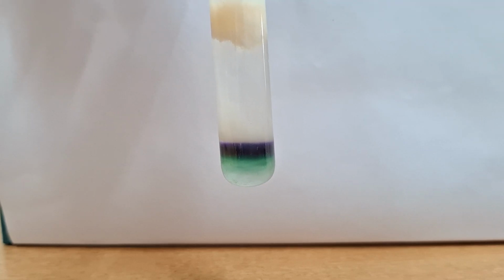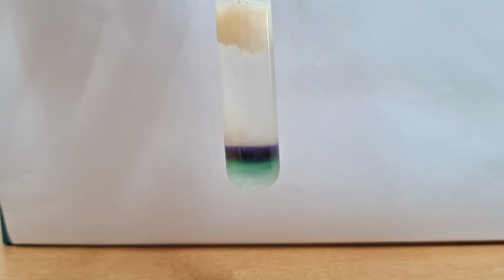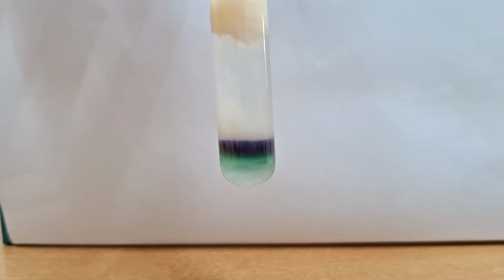All carbohydrates, when treated with concentrated sulfuric acid, undergo dehydration to form furfural derivatives, which on condensation reaction with alpha naphthol form a violet colored complex. Now how will you perform this test? You have to take 2 ml of protein solution plus 2 drops of alpha naphthol in it, mix, and add 2 ml of concentrated sulfuric acid carefully through the side of the test tube without shaking, and you can see the purple violet color ring formed between the acid and solution.